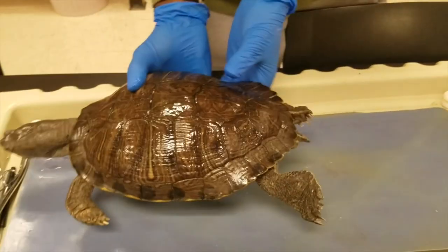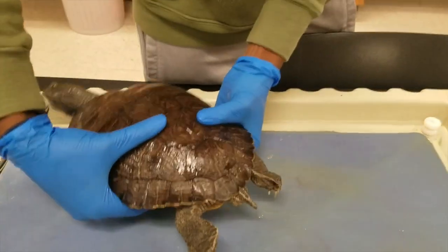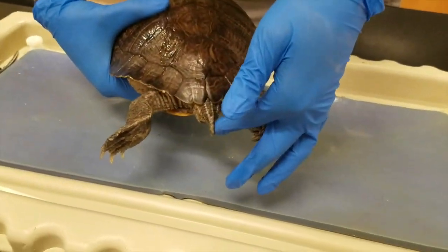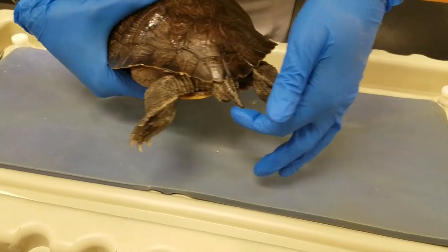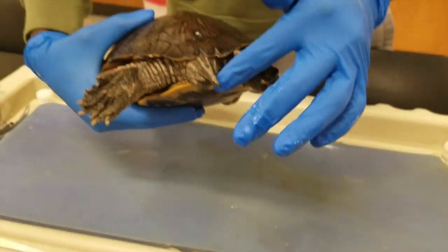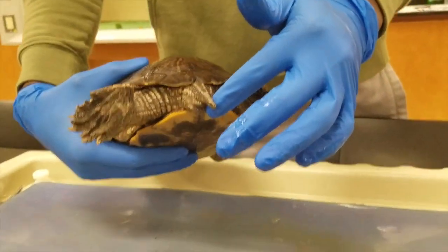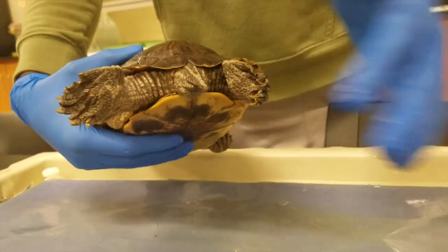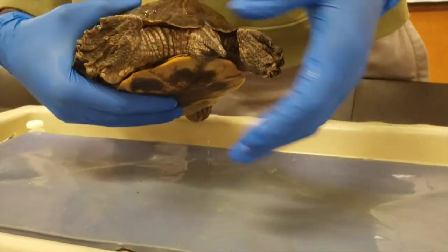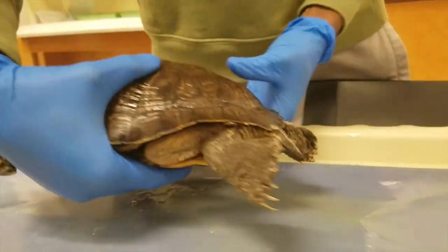At the posterior end of the turtle, we'll notice a muscular tail that it uses to navigate the water better, as well as a cloaca underneath here that it uses to excrete waste as well as eggs and other things.